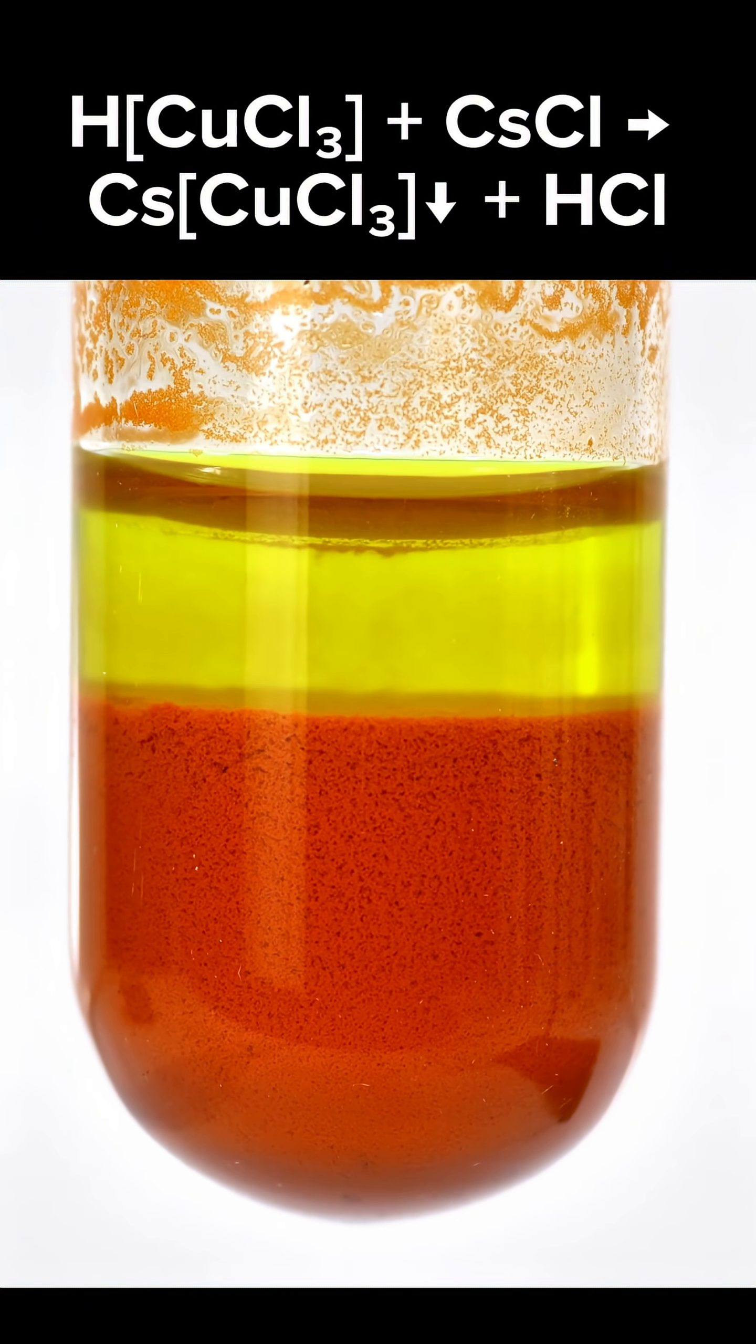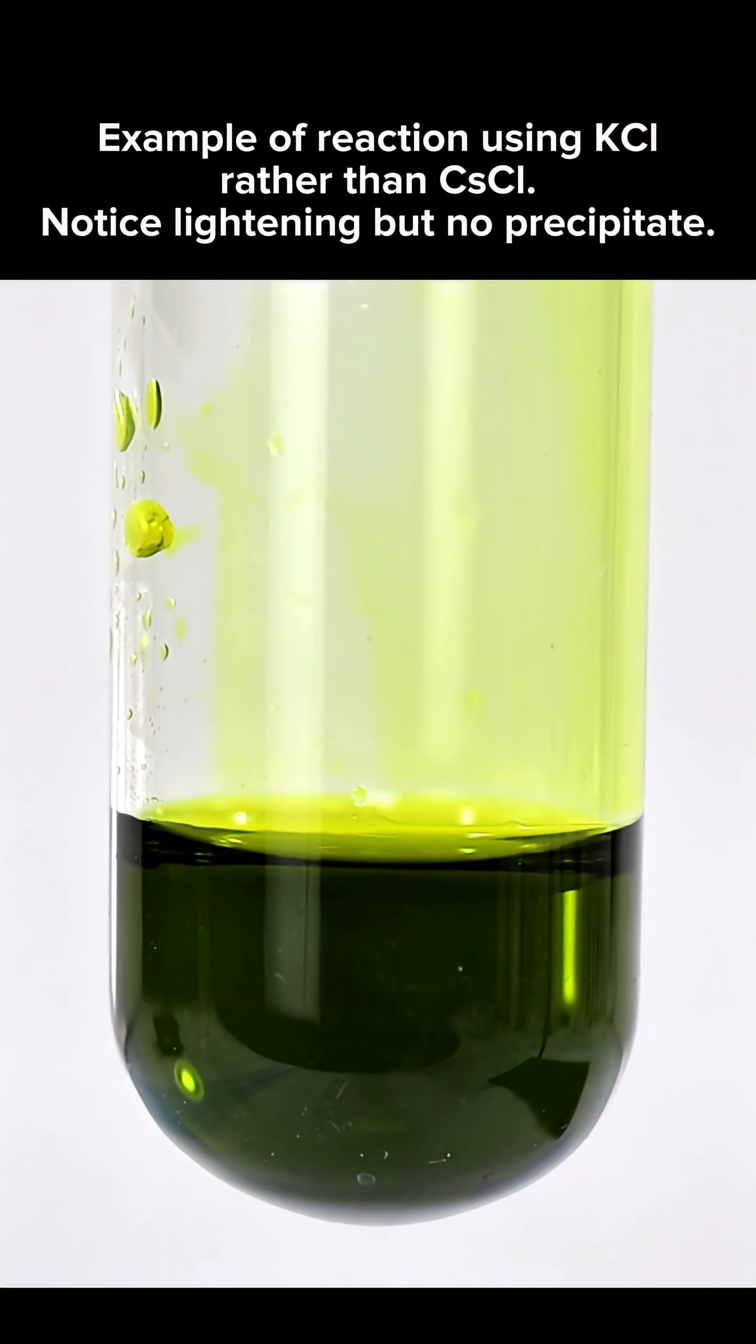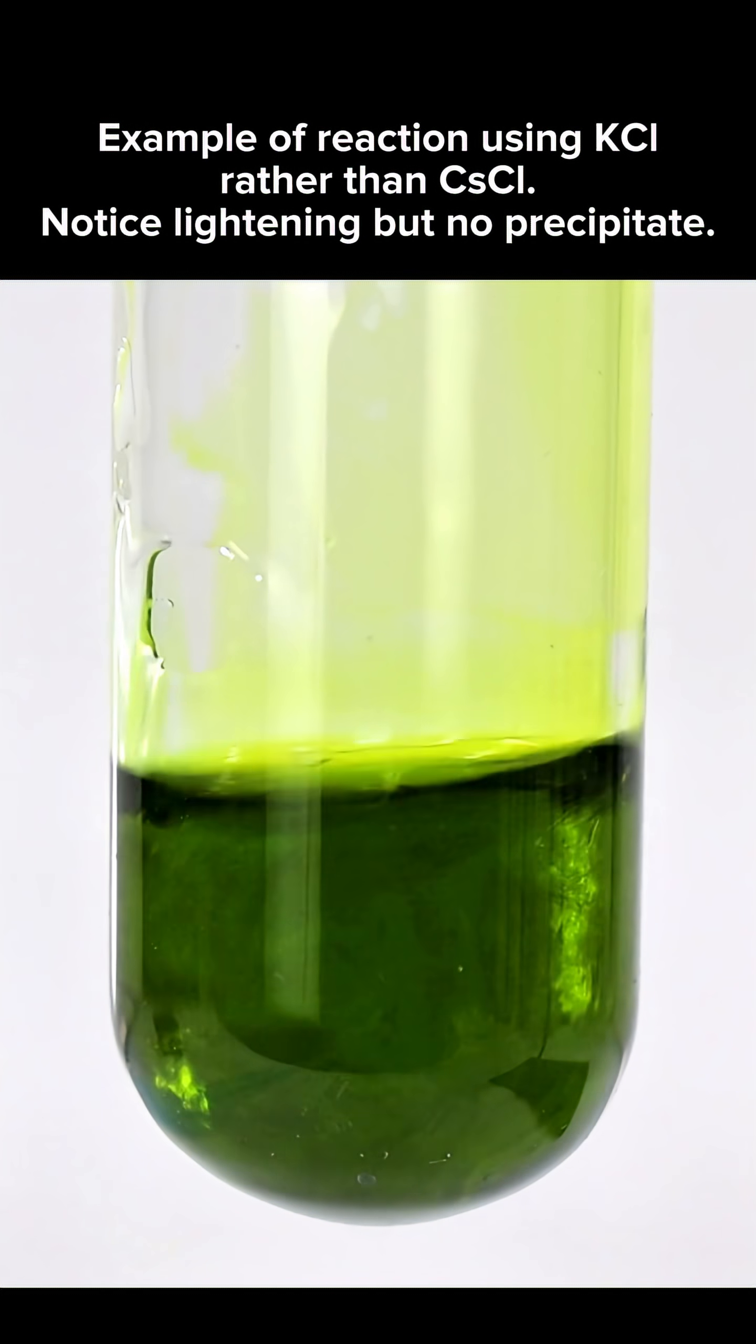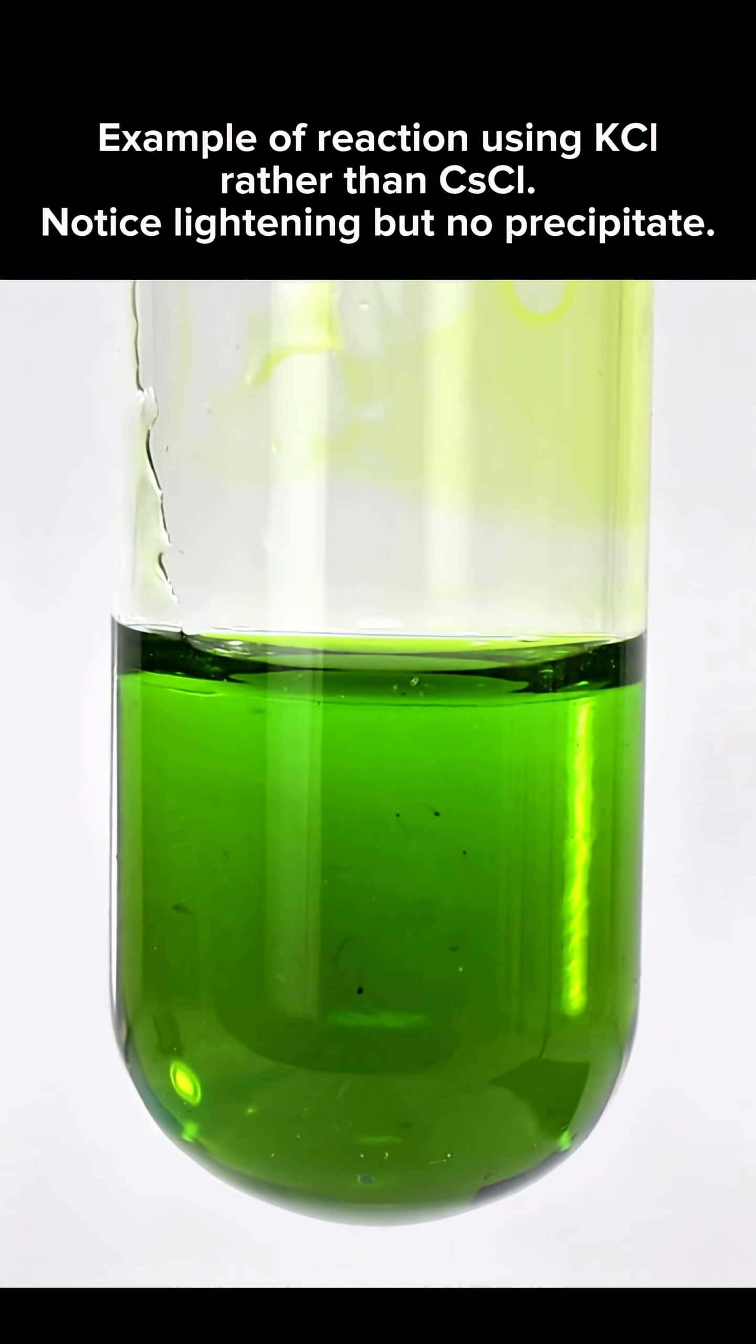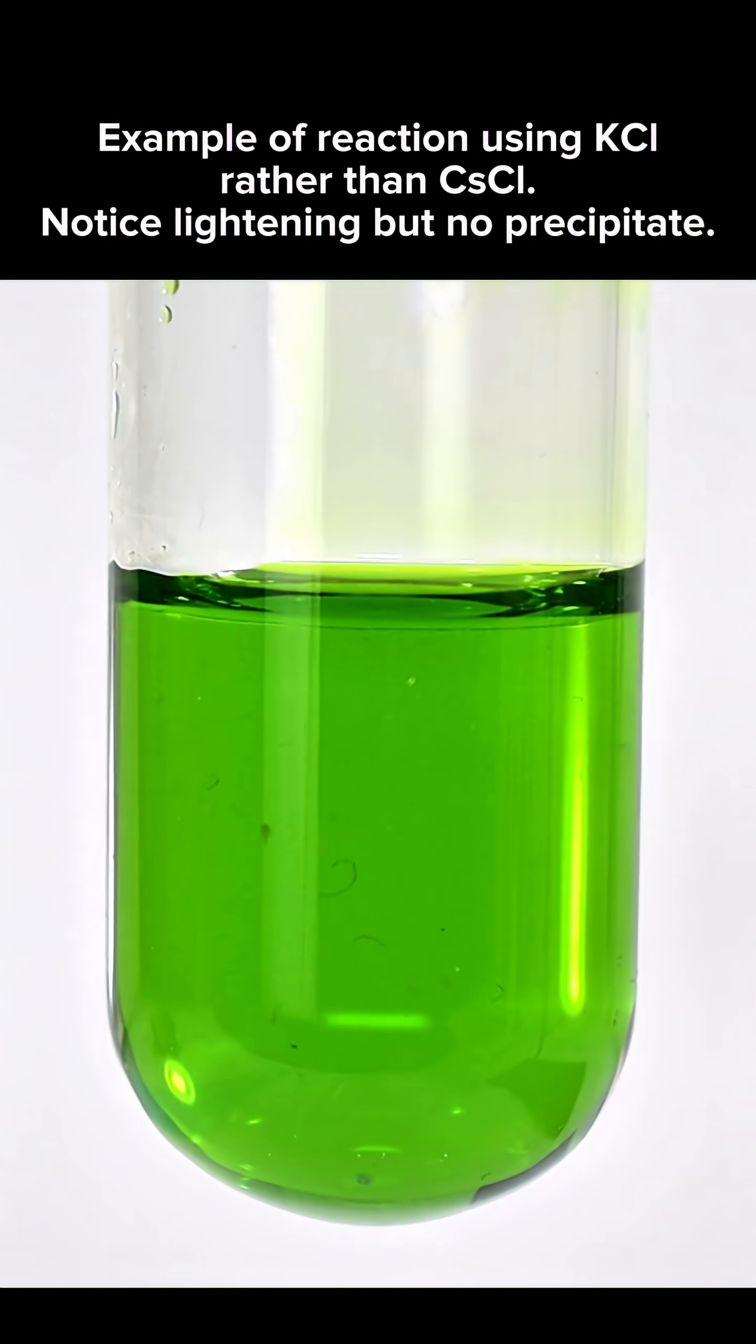If I try the same procedure with potassium chloride instead of cesium chloride, you'll notice that no precipitate forms. This is because even though potassium can bond to trichlorocuprate, it's too small to form an insoluble complex.